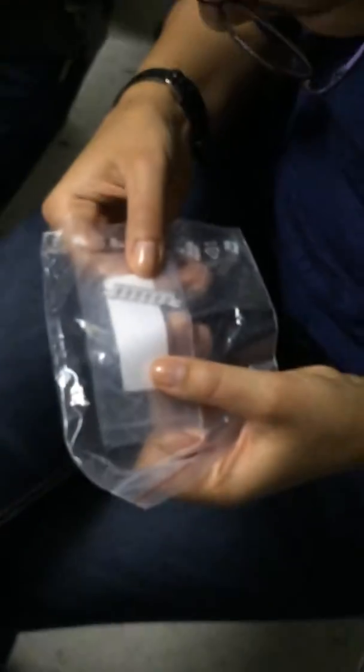But the holder, here's the holder here. So this is the holder. You can see it can take 5 or 6 grids, and they all have little flaps that are going to hold it by the skin of its teeth, so to speak. So it's just going to hang out there. Each of these ones? Yeah, so each one is like a clip. So it clips the edge of it.